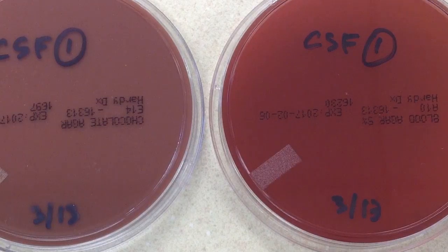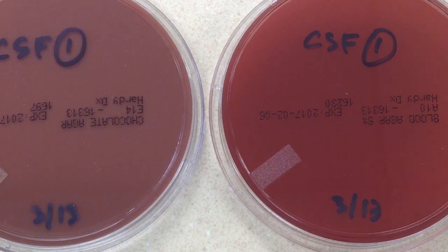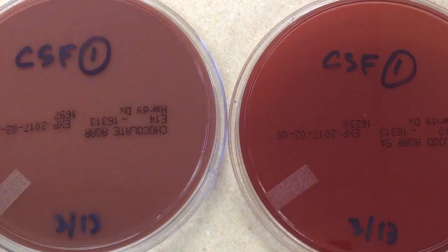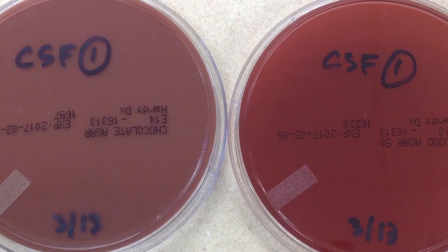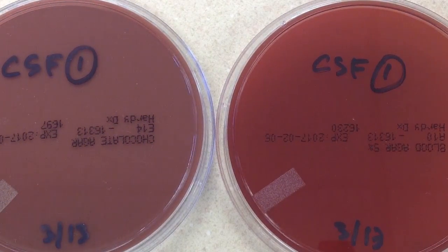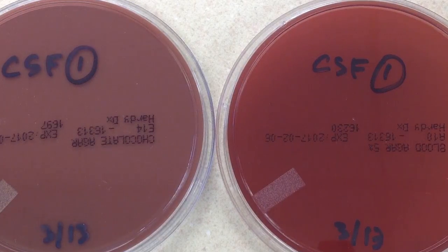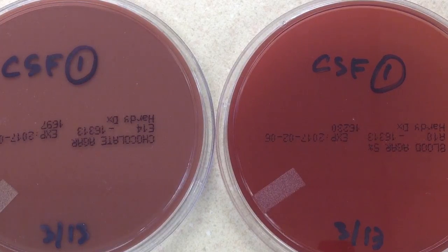In all these videos I won't talk much about working up organisms in detail, but the first test we always do when working up a gram negative coccus is the oxidase test. Your instructor may have you do a gram stain first, and that's not a bad thing to do. But based on my experience, the gram stain of the specimen, and the growth pattern on the plates, I'll move ahead to the oxidase. We expect Neisseria and Moraxella, which are gram negative cocci, to be oxidase positive.